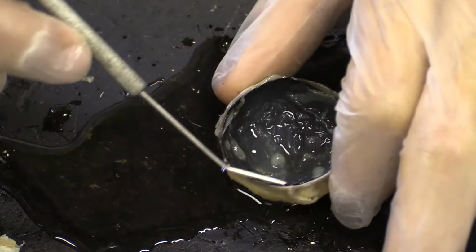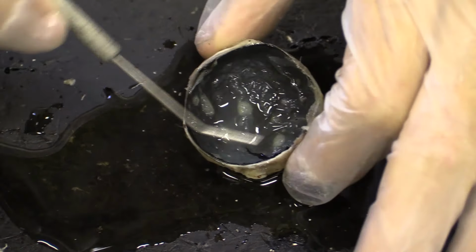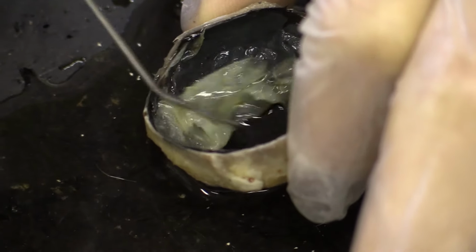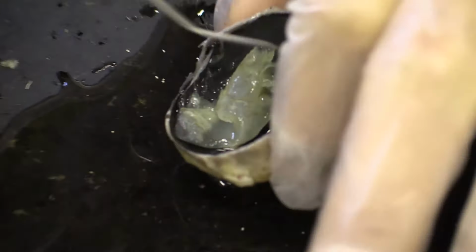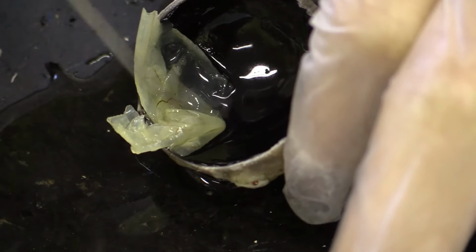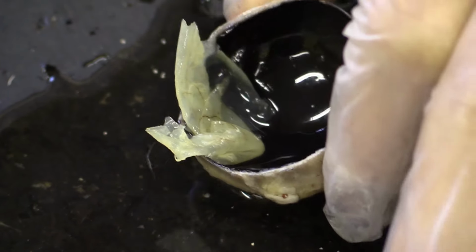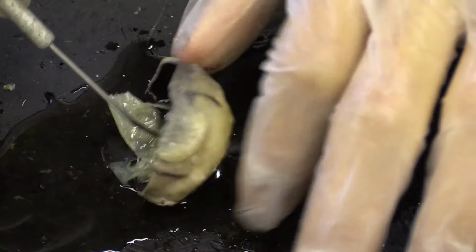So if I just push away the retina, very gently, you can see it all converges onto this one point where it's fixed here, the optic disc, your blind spot where you can't see, which goes directly to the optic nerve, which I just mentioned a minute ago.